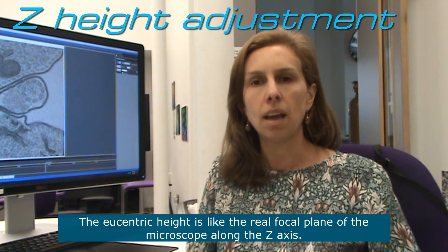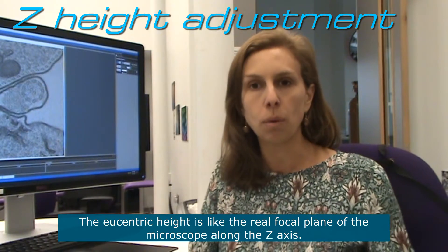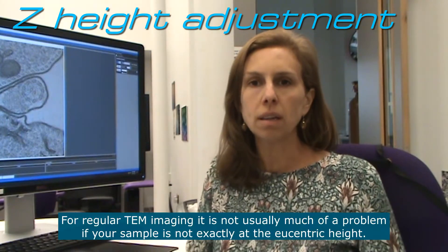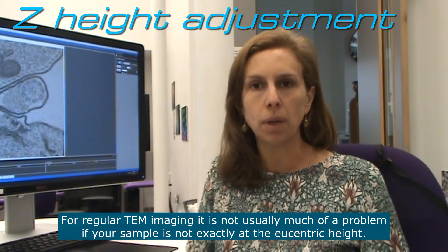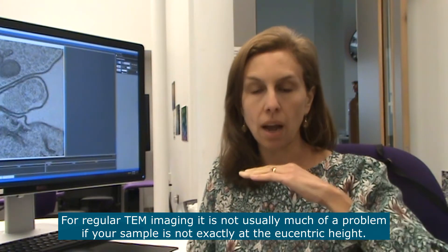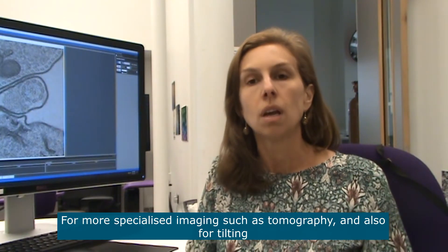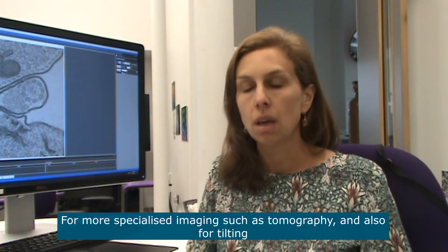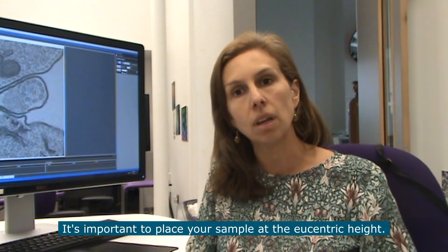Eucentric height is the real focal plane of the TEM microscope along the z-axis. For regular TEM imaging it's not usually much of a problem if your sample is not exactly at eucentric height, but for more specialized imaging such as tomography and also for tilting, it's important to place your sample at the eucentric height.